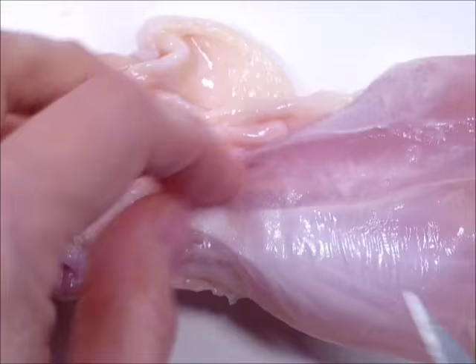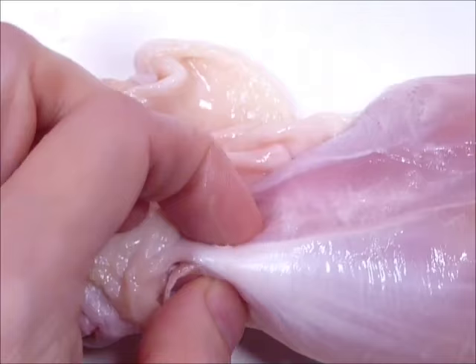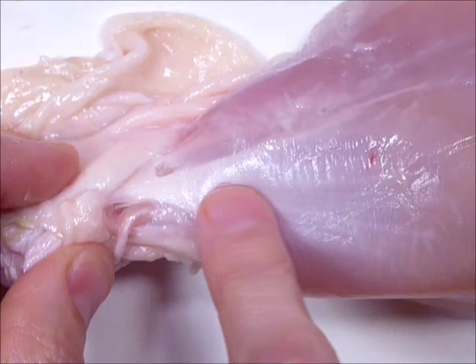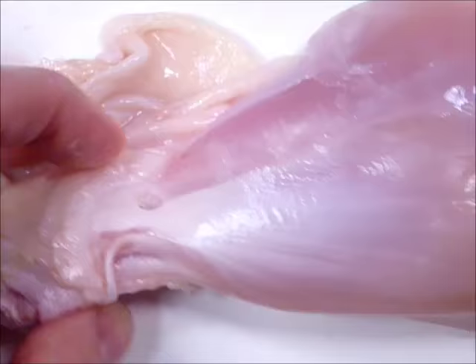The tendon is part of this fascia bag — it's like the bag. You can see the bag getting thick. Wherever the tissue gets thick, it's going to get white; here it's so thin it's clear, and it gets thicker further along. The bag kind of gathers, just as if you'd take a paper bag and crumple it at the end, making it look more solid. That's exactly what's going on here — it's the bag that's attached to the bone.